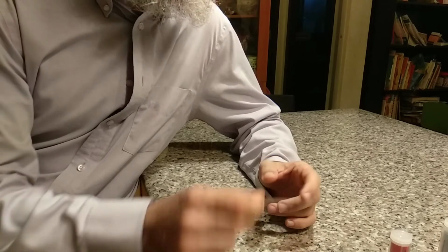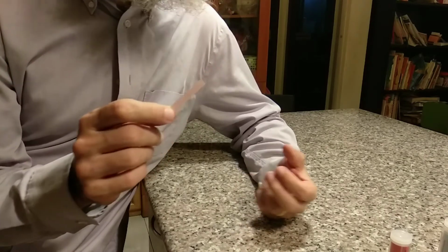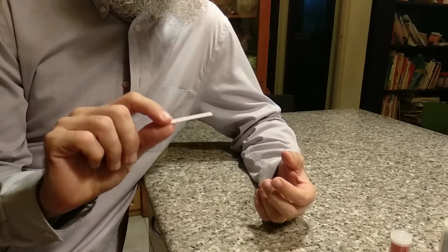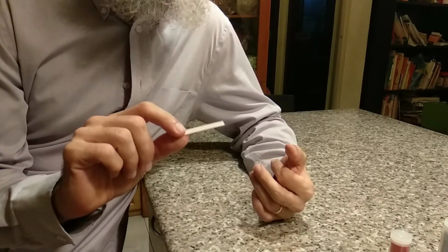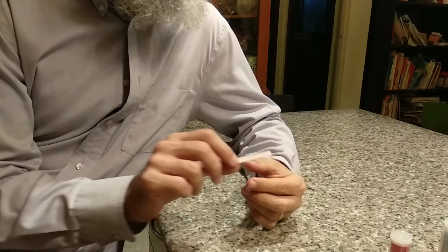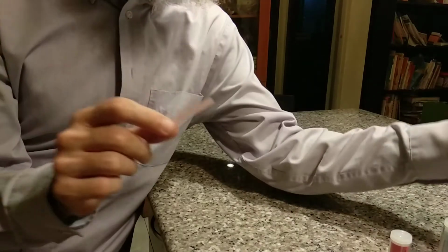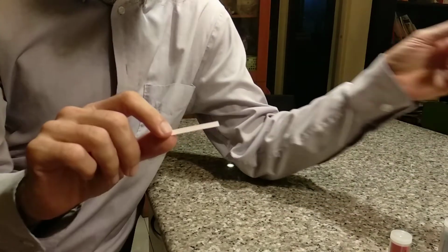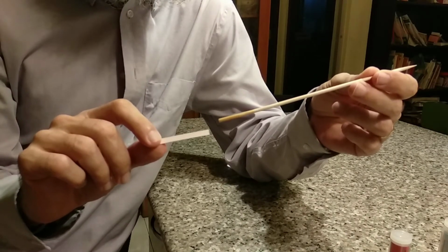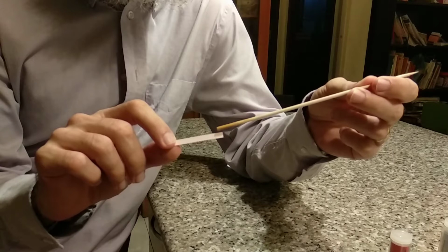One example of an indicator that we use in the lab a lot is litmus paper. Litmus is a chemical that comes from a lichen, and it has a very specific property that makes us like it in the lab. So if I have an acid, it might change my litmus paper. Here I've got some vinegar, and I'm going to put my vinegar onto my red litmus paper. What do you think is going to happen when I do that? Make a guess, and then let's see.